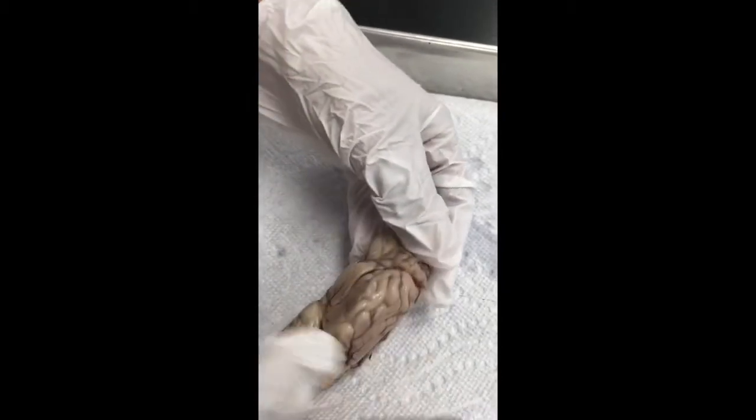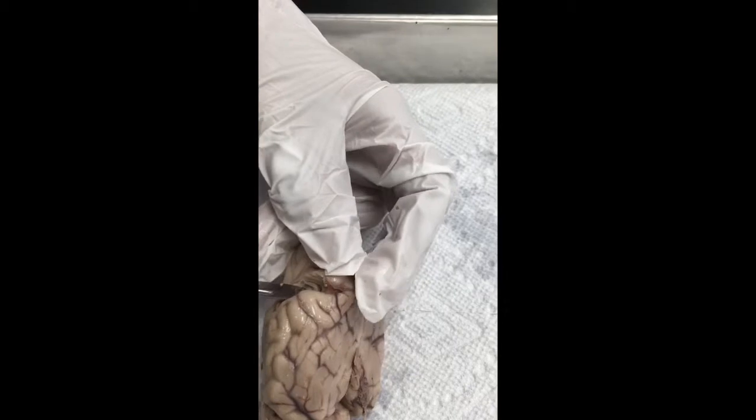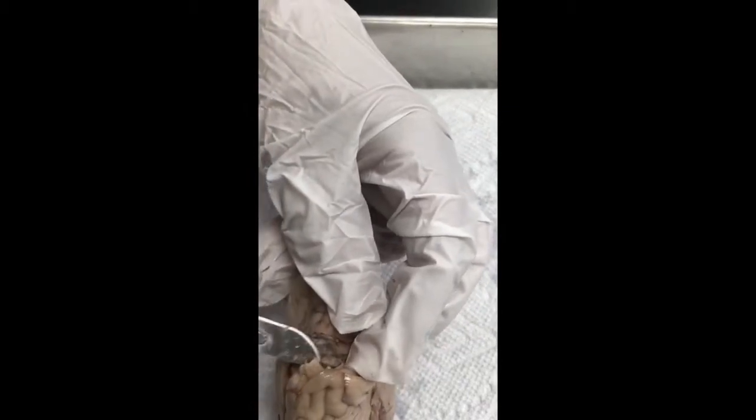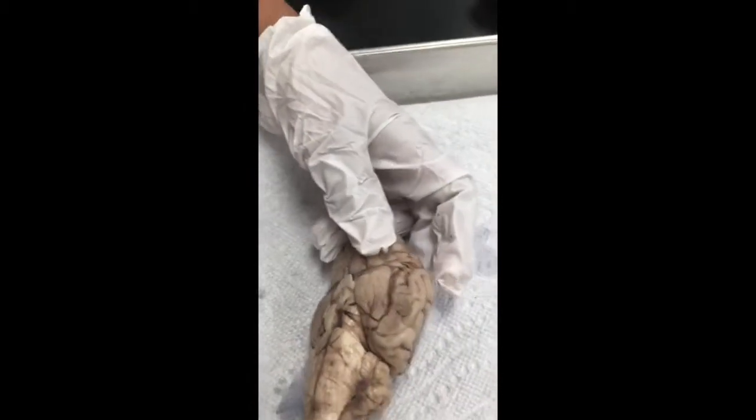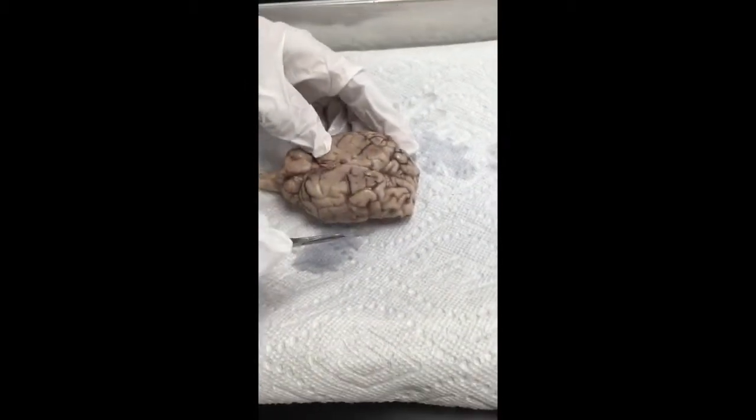What brain is this? The sheep brain. The sheep. Look at that. This is the guy. That's the insula. No, you're taking it. Be careful. That's the insula. That's the insula. We are going to see the gyri for the insula. That's the insula. Okay? Now, so that's the gyri.